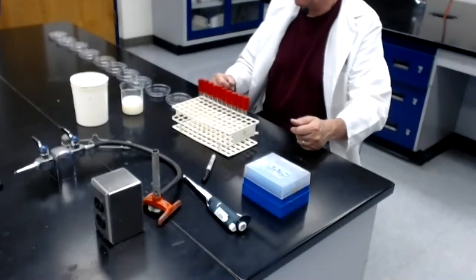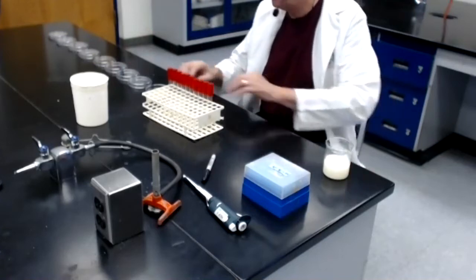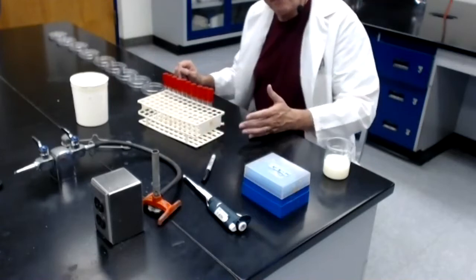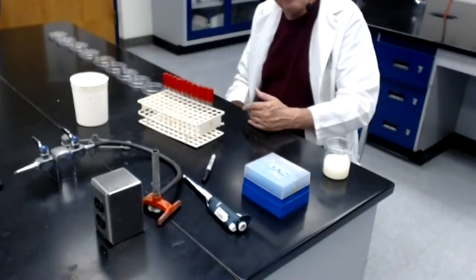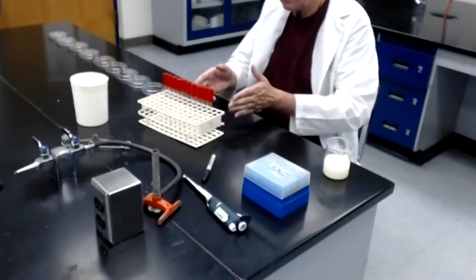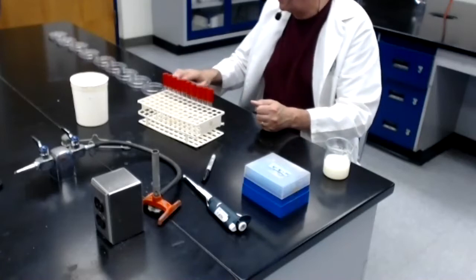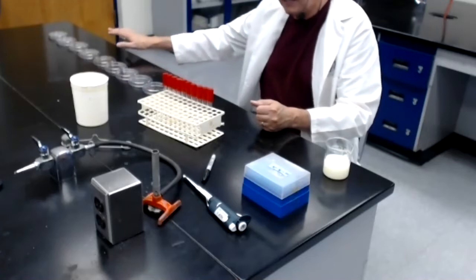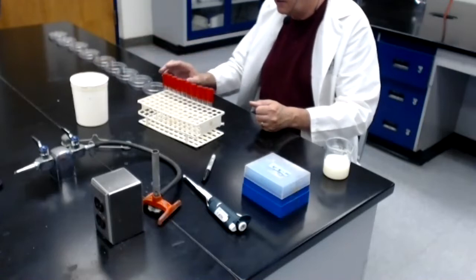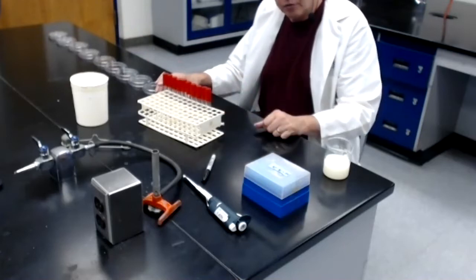Okay, let's go through the protocol. I'm going to put my sample of milk here on my left. Make sure all the plates are turned over. Now, I'm not going to do this in front of you, but what I have done already is I have labeled each of the dilution tubes. Remember, each of these dilution tubes contains 9 mils of sterile distilled water. I've also labeled 10 empty sterile petri dishes with the same dilution numbers so that there is a petri dish that corresponds to each of the 10 dilution tubes.